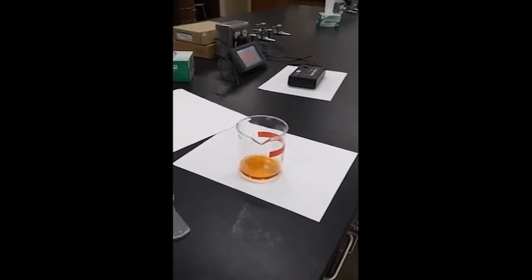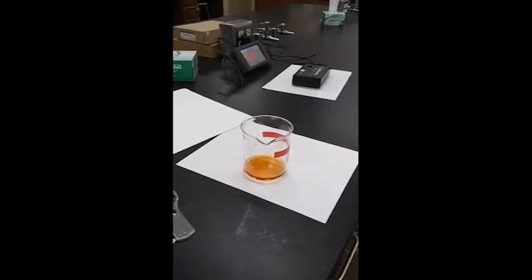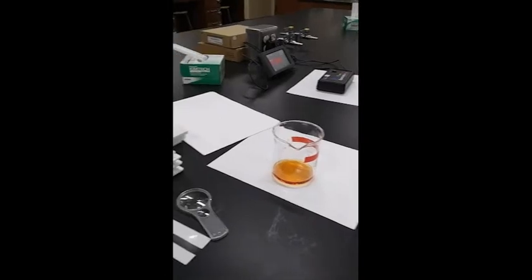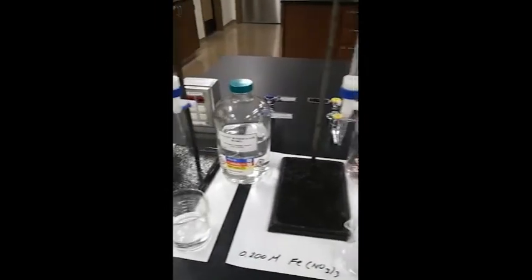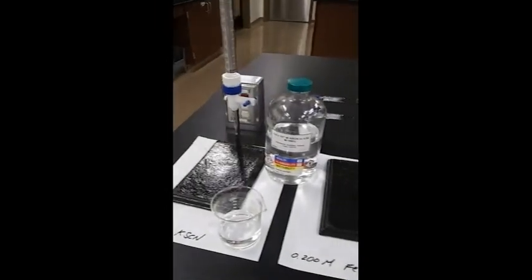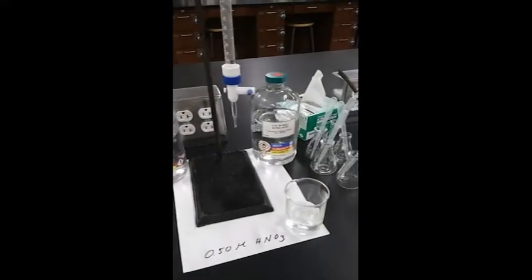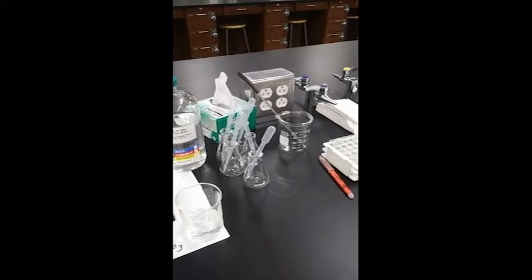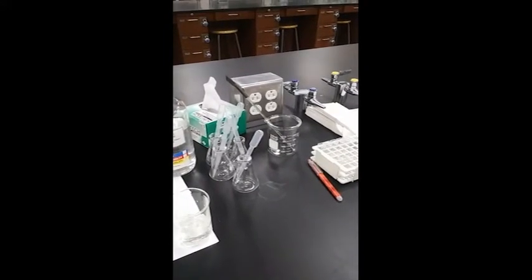Note the reddish orange color of the iron thiocyanate complex being produced in this experiment. I'm going to begin by preparing my five standard solutions according to the procedure. I'll be adding the potassium thiocyanate, the iron(III) nitrate, and lastly, the nitric acid to each of five flasks, producing five different concentration solutions — my five standards.